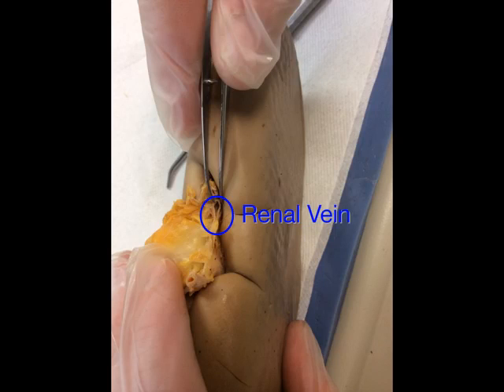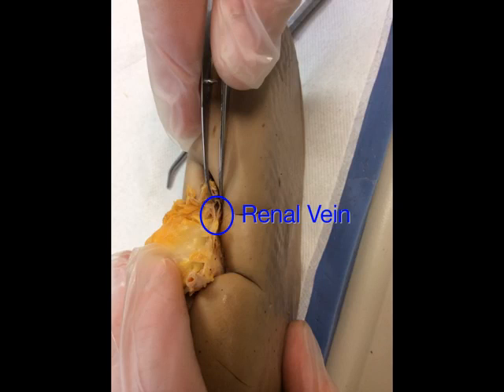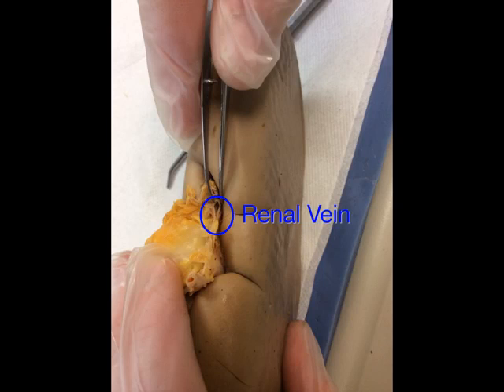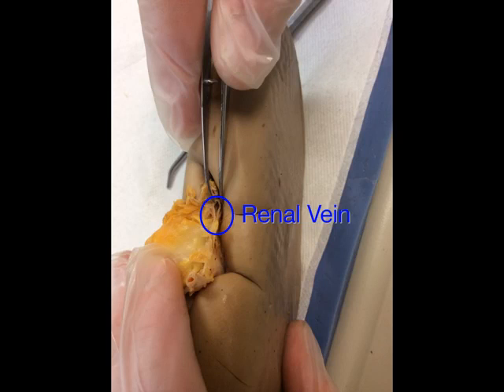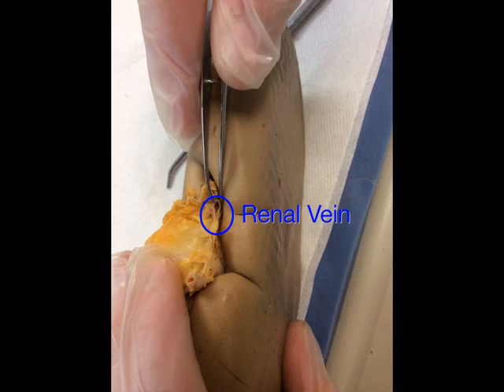Also at the hilum is another blood vessel that exits the kidney. This blood vessel is called the renal vein. Notice that the diameter of the renal vein is much larger than that of the renal artery, and the wall of the renal vein is much thinner than the renal artery.